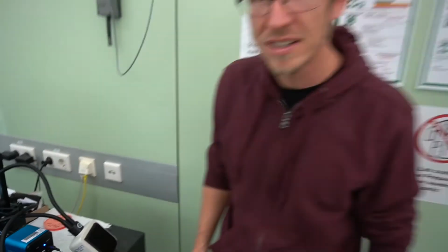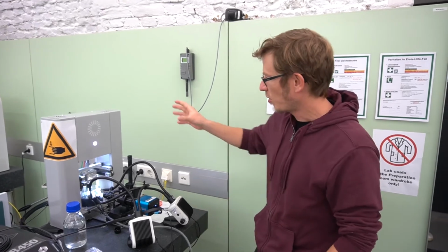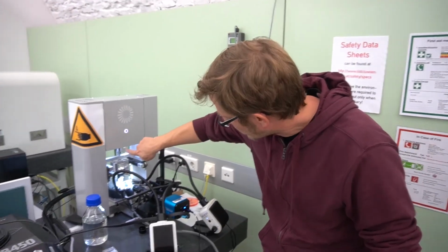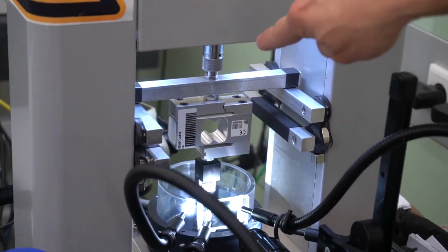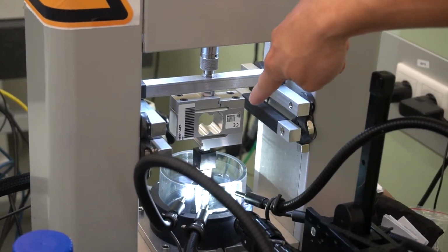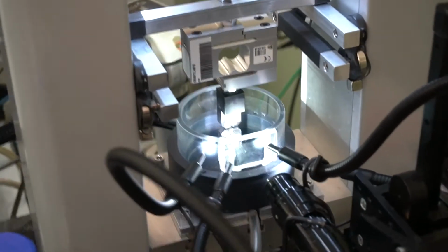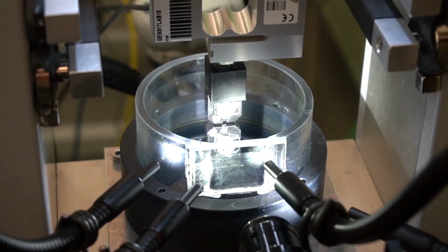And for doing this, we have our test equipment here, which is consisting of this load frame. This is the gray part here, and this load frame is doing something very simple. So it's only moving this rod in there up and down. And for measuring force, we have mounted this 100 Newton load cell here, which is this aluminium frame with this funny hole. And at the bottom we see the sample holder itself. So it's a bit complicated, and we will give more detailed shots later.